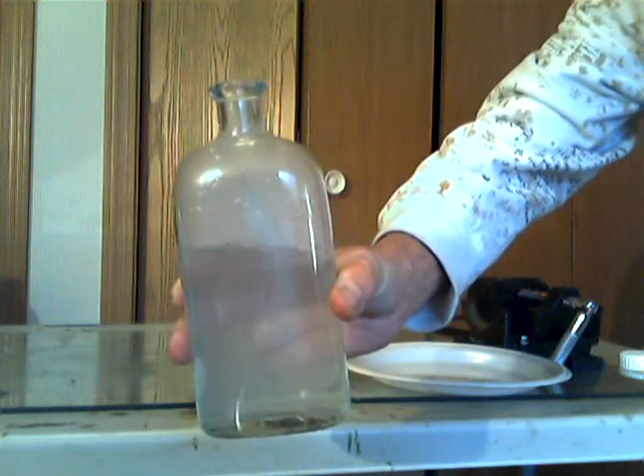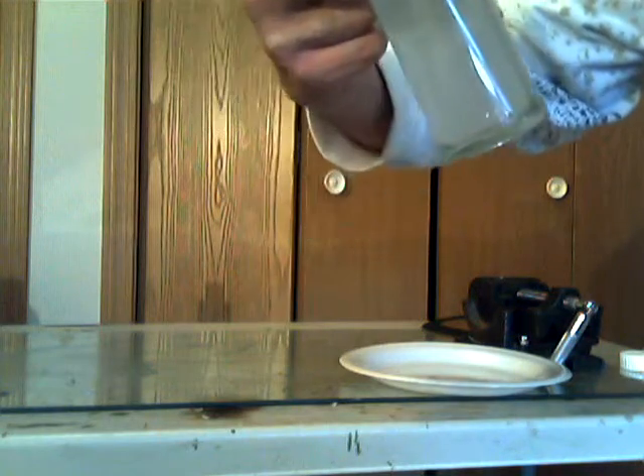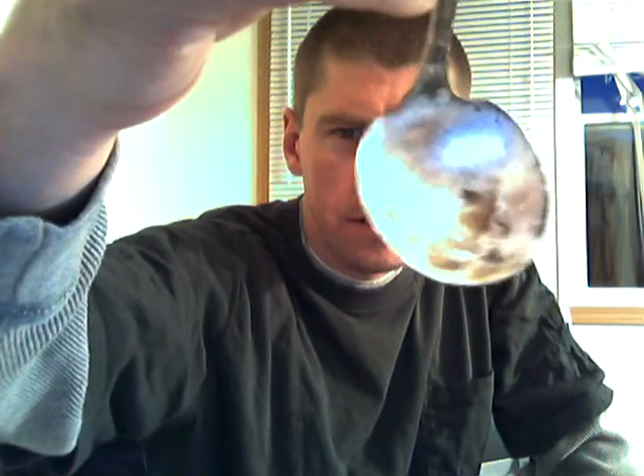How disappointing. You can see the sodium hydroxide that it made. That sodium may have had a slight amount of sodium hydroxide dissolved in it because it was made at high temperature — so if anyone has any input on that possibility, let me know. You can see those shiny spots; that's where the sodium metal kind of soldered to the spoon. Don't use silver.